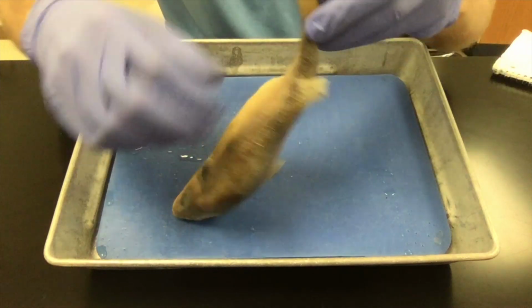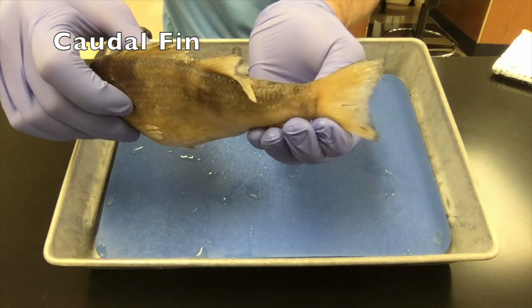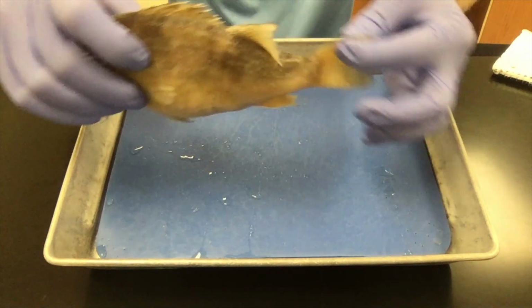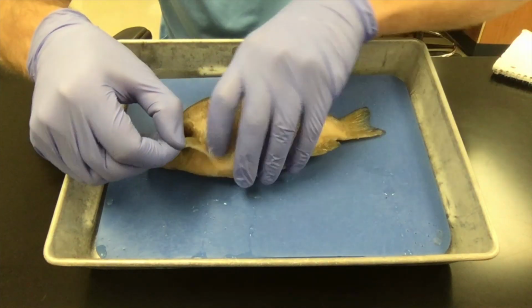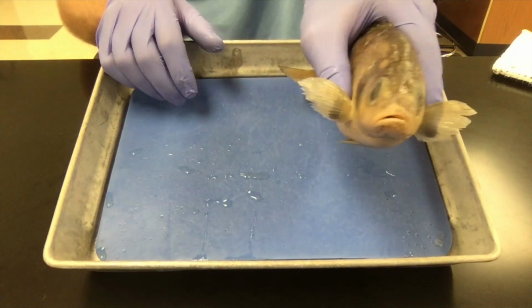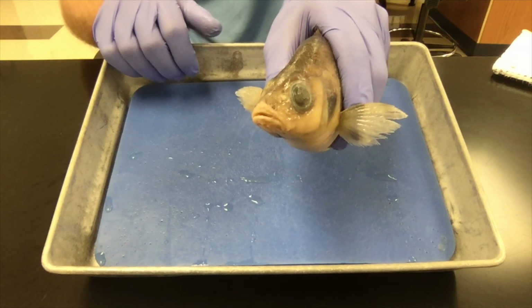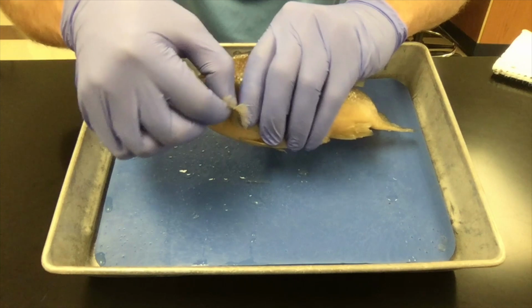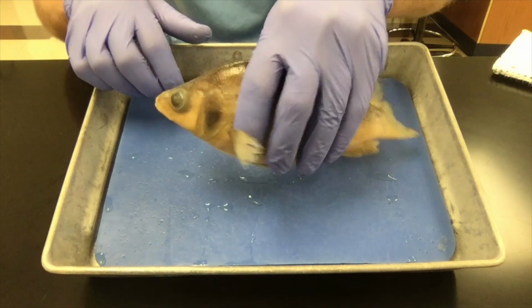Next, in the back, the tail fin is also called the caudal fin. The caudal fin is the motor of the fish to make it move forward. On the sides of the fish are 2 paired pectoral fins. You also have pectoral muscles. If you've ever worked out your pecs, those are your big chest muscles. So these are almost like the arms of the fish. They're used to steer them right and left.